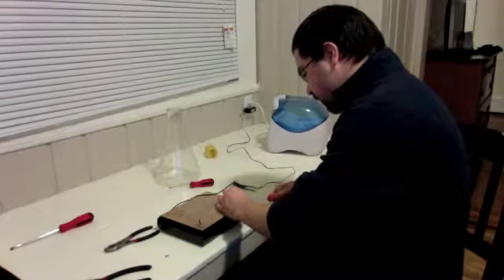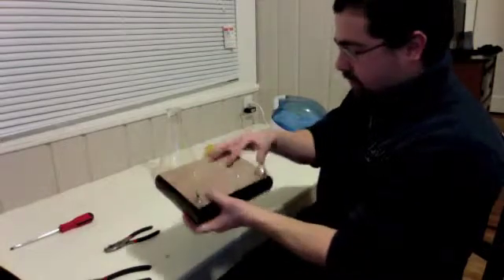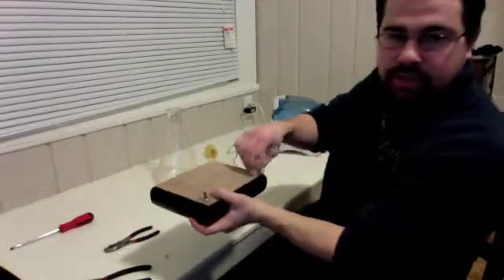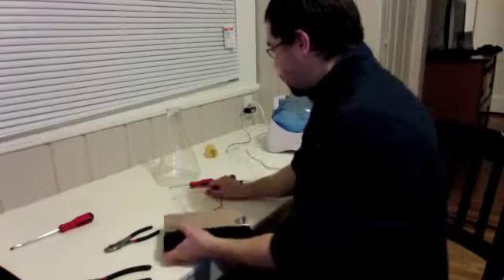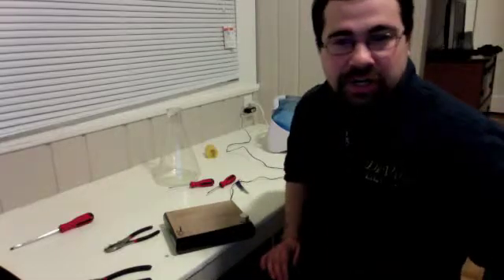Actually, we should really have a yeast starter on there, but screw the knob on, and there you go. That's what you have. You have the pill magnet? I don't. I'm unprepared, folks. Alright, we'll take 5.